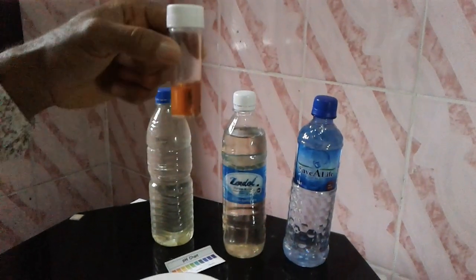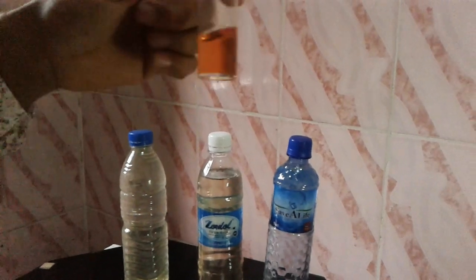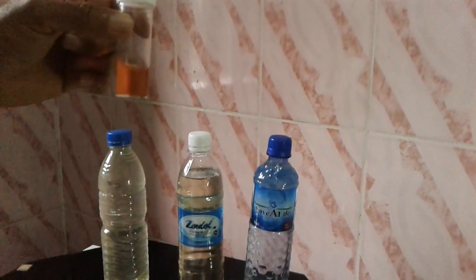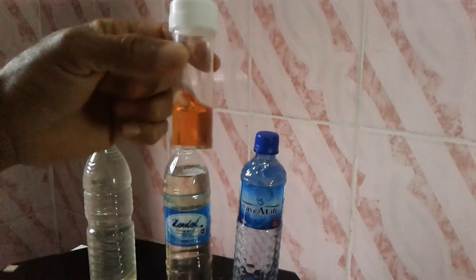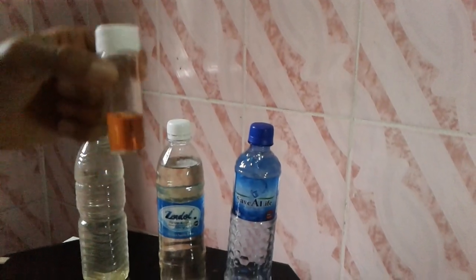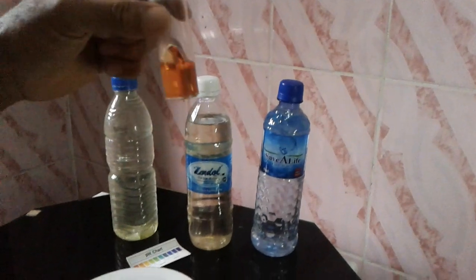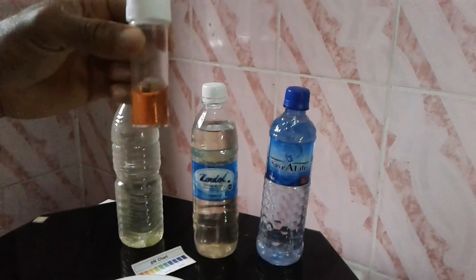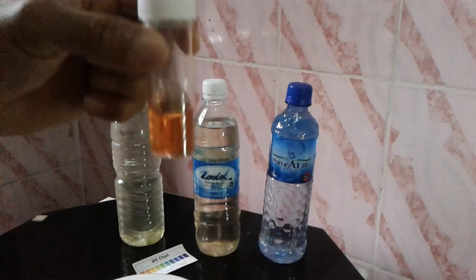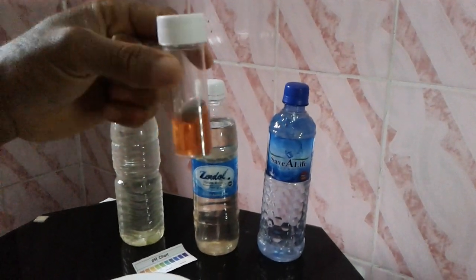My neighbors here in the office — I believe most of them might be drinking this water without knowing it is acidic in nature. This is clearly acidic. So this is the water I have in my office.